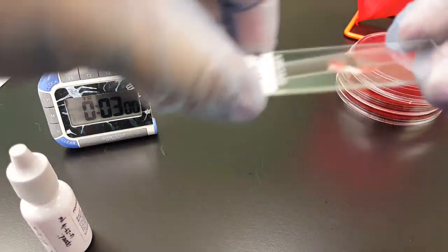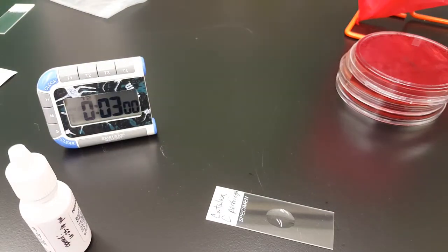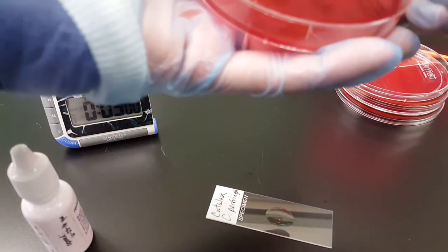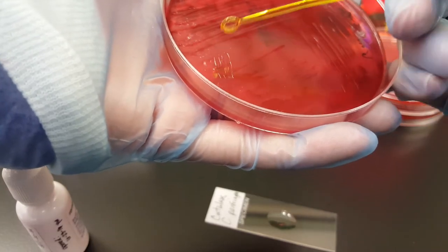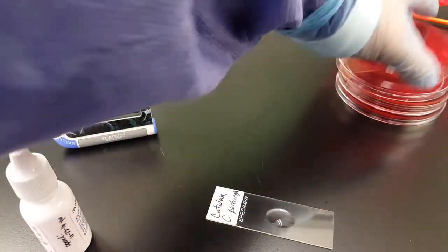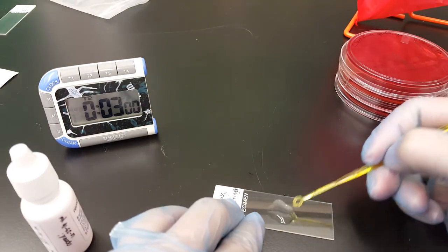And there is no bubbling whatsoever. I don't see any bubbles at all. Just to make sure that we did have organism in there, I'm going to put some more. It's hard to tell if I'm really getting it on there or not. And rub it around in there to see if that makes a difference.